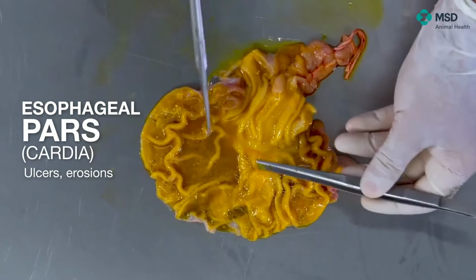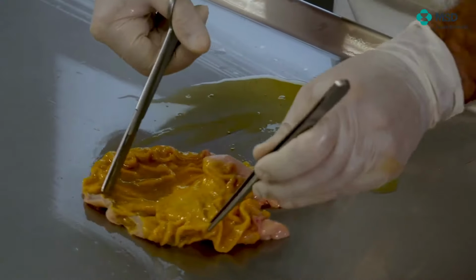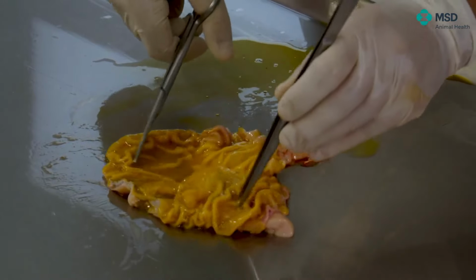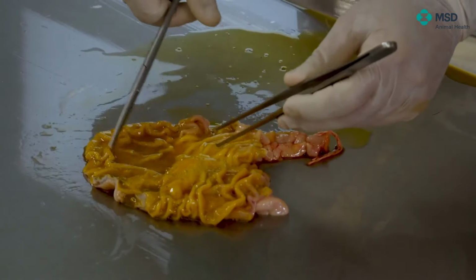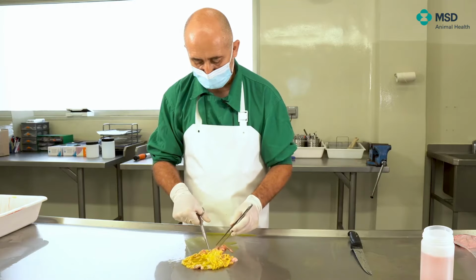And why is it so important? In fact, 95% of the pathology in the stomach is gastric ulceration, and gastric ulceration of the pars esophagea. So the part that you should look at is basically here, and is where you can see erosions in the very first moment sometimes, or previous to the ulcer, and then ulcerations.